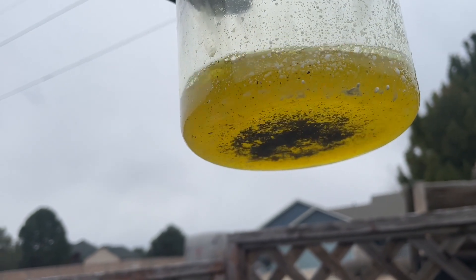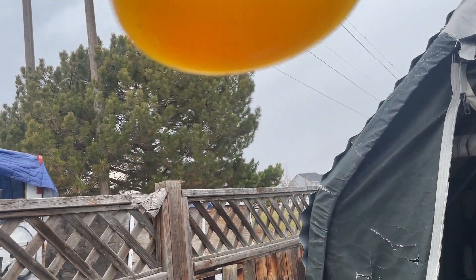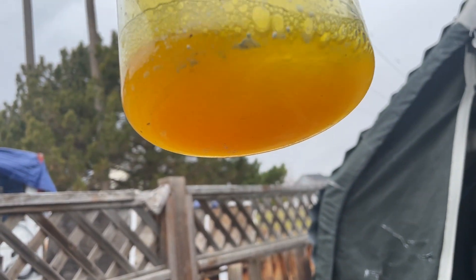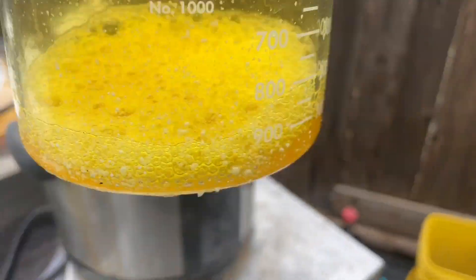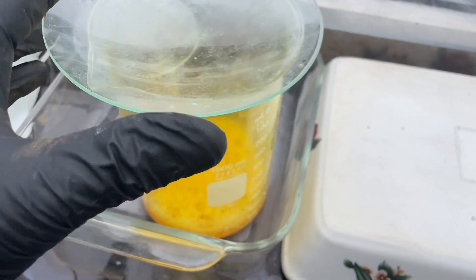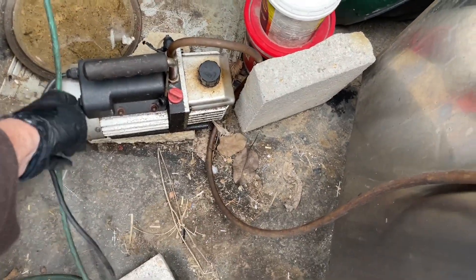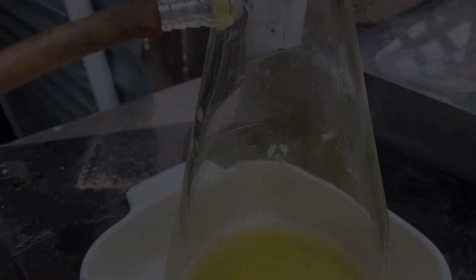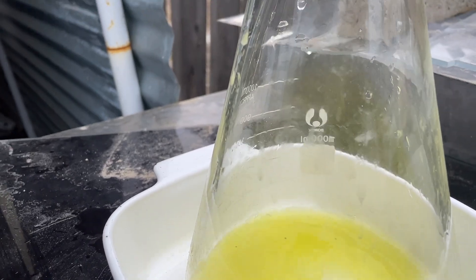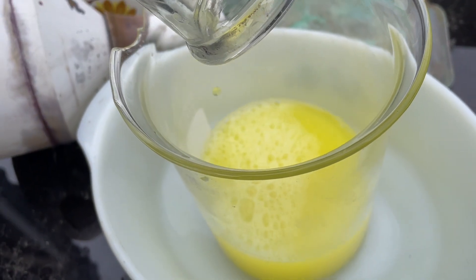Put a lid on it — that didn't take long to change the situation big time. Yeah, it's starting to attack that material like mad. Didn't take too long. It's a little bit under a minute. It looks like we are already discombobulated so there's no sense keeping it on the heat. We'll let that start to cool. I broke up my filter apparatus and we're going to filter it — the gold's dropping — and we'll refine it probably again.